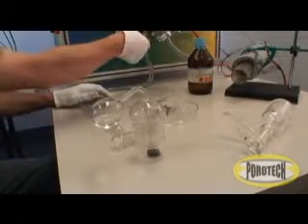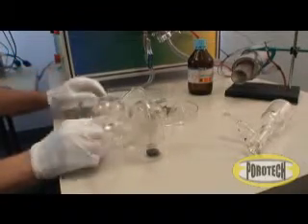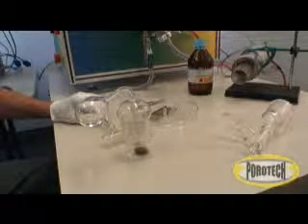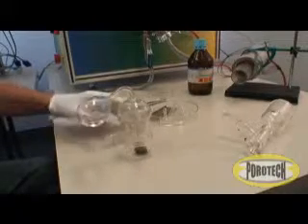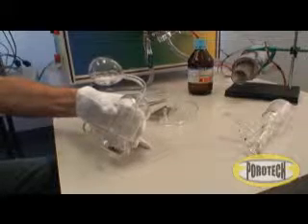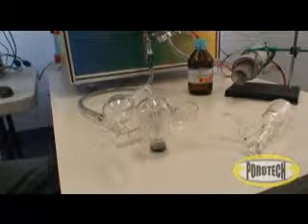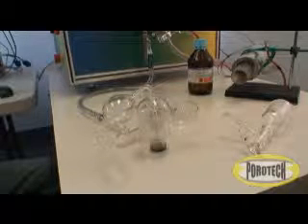The vacuum pump is turned on and the octane is introduced into the sample holding vessel. Various liquids such as water, octane, decane, or even some electrolytes can be used for testing. Unlike other methods, this gives you a unique understanding of how the pore structure of your material performs in its own working liquid.